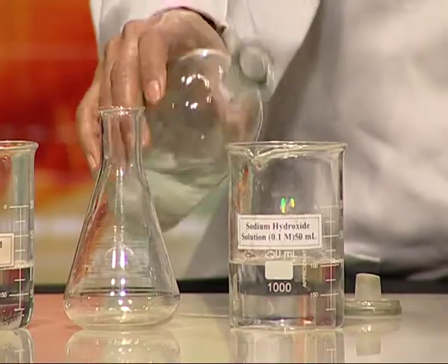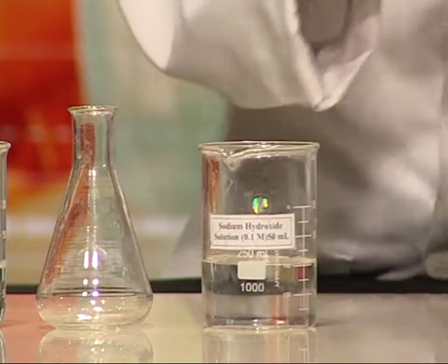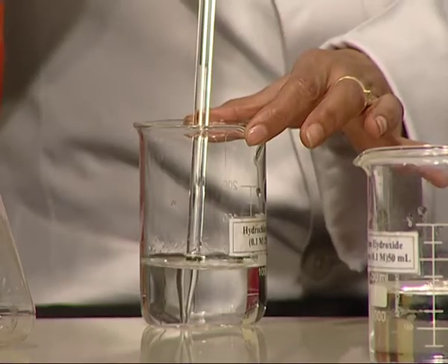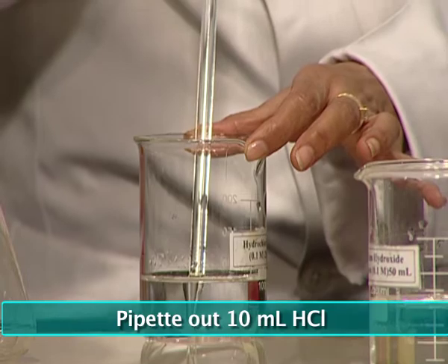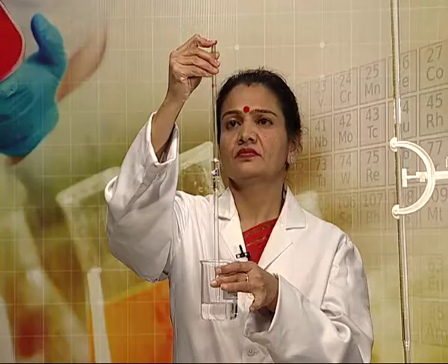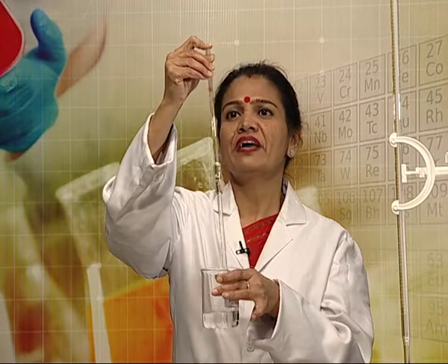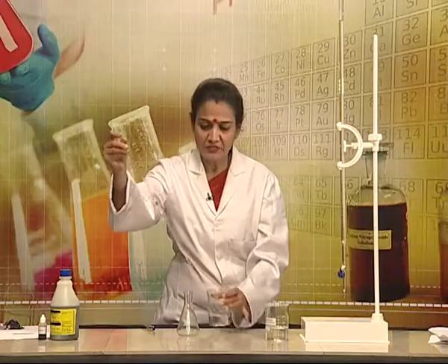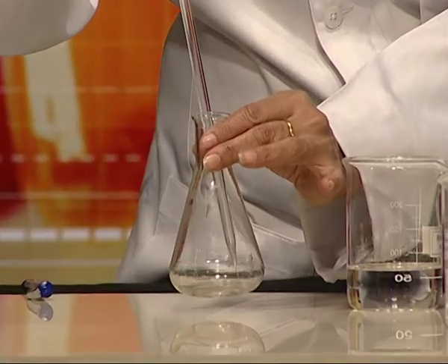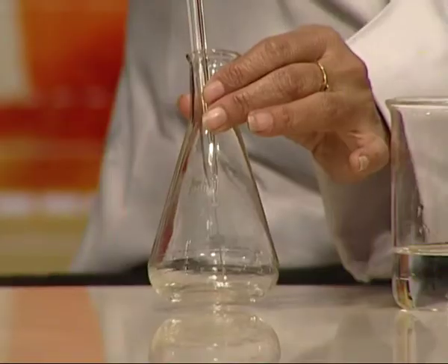Now we start titration. Before starting titration, we note down the reading of the burette. That is the initial reading, which is 0 — the lower meniscus is at 0. I have taken 10 ml of HCl in the pipette and am transferring it into the conical flask. When we transfer the solution into the conical flask, take care.